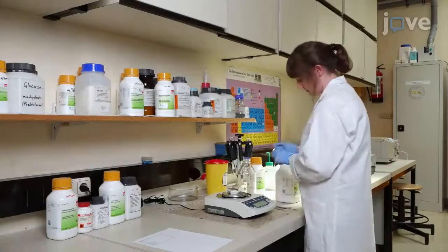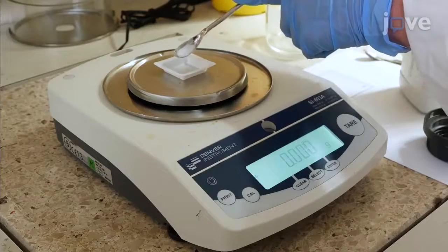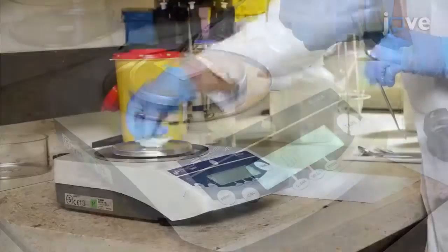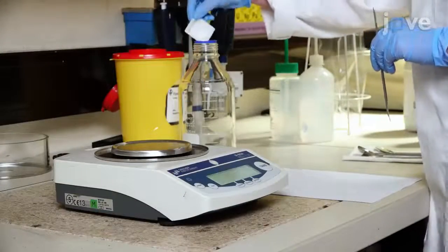Start by weighing medium ingredients in an appropriate flask and dissolving them with half volume of distilled water.